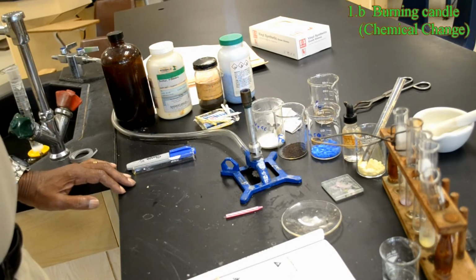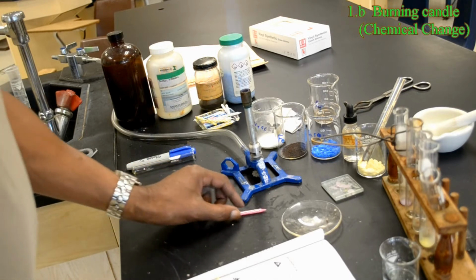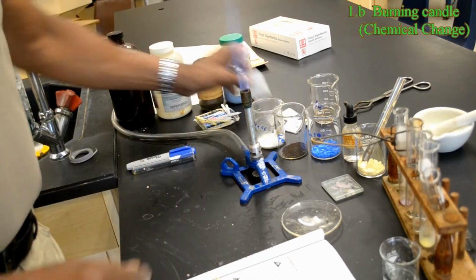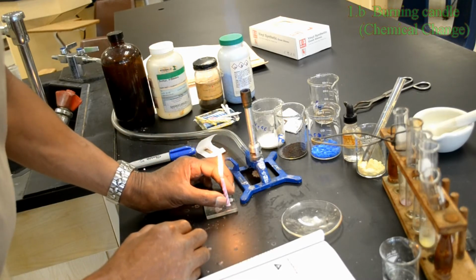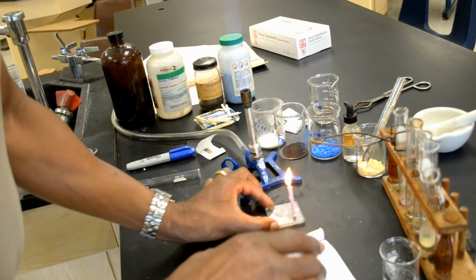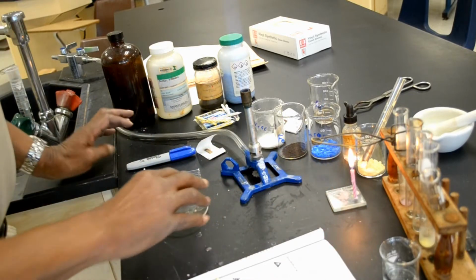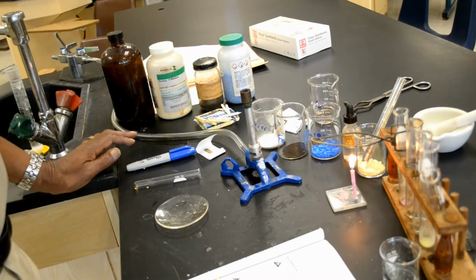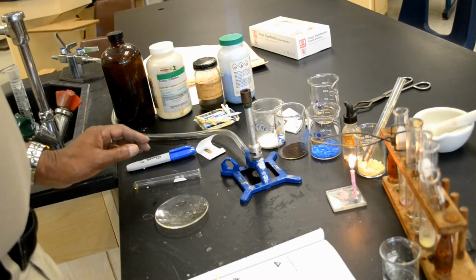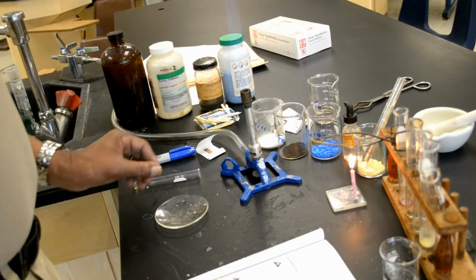Next, light the candle and secure it to a glass square, and allow it to burn until it extinguishes itself. Proceed with the rest of the experiment while the candle burns.